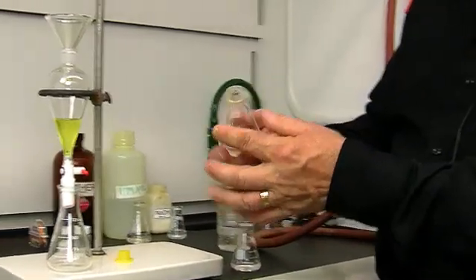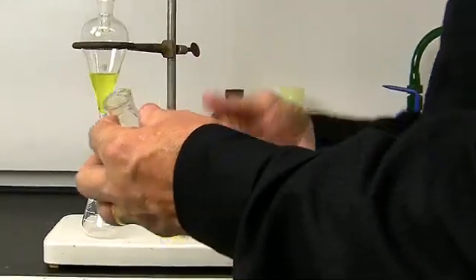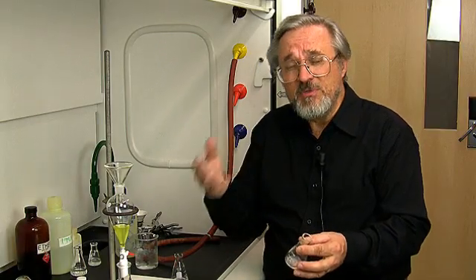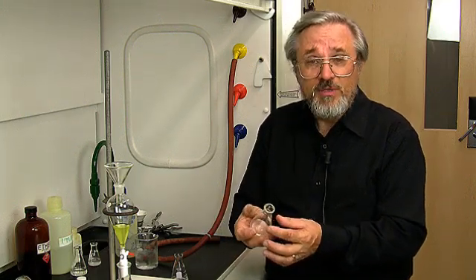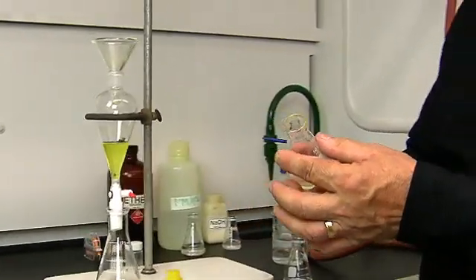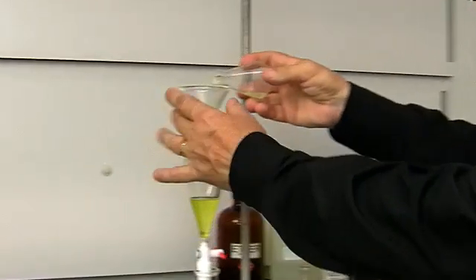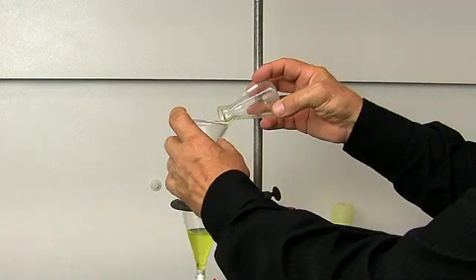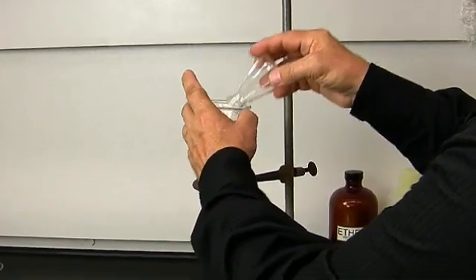The reason that we have to do this is that diethyl ether has a boiling point of 35. Now the human body temperature is about 37 degrees centigrade, so technically, you could actually boil diethyl ether in your hand. It's not that easy to do, but it does leave a residue because it evaporates so readily.